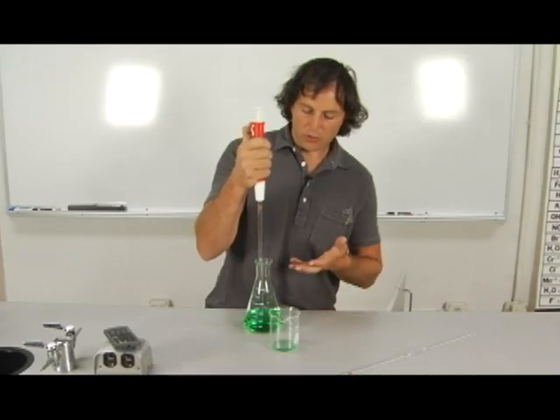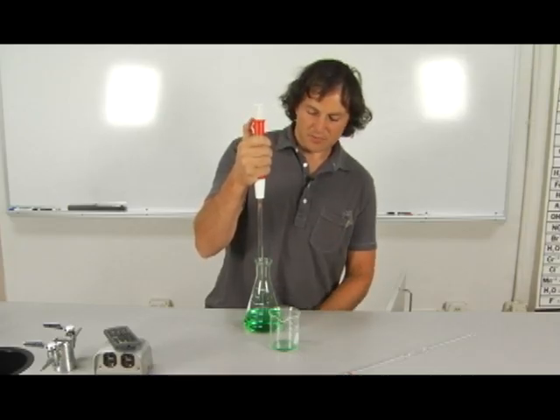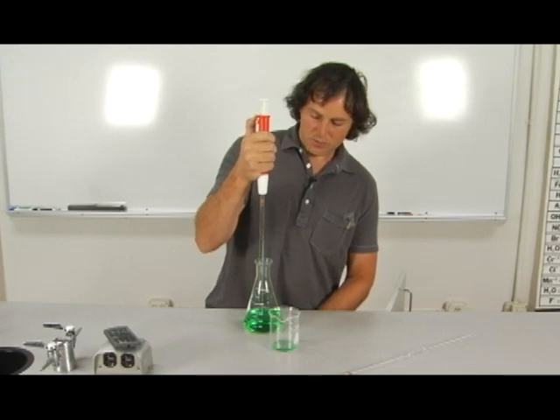We'll pull with our thumb and then the fluid will go up and you let go and it'll still be going up. So I'll take this up to about one milliliter.